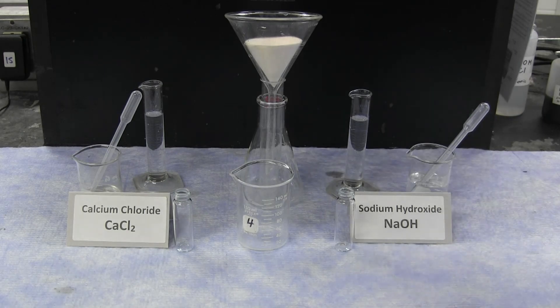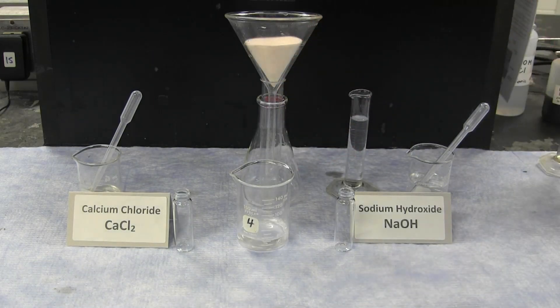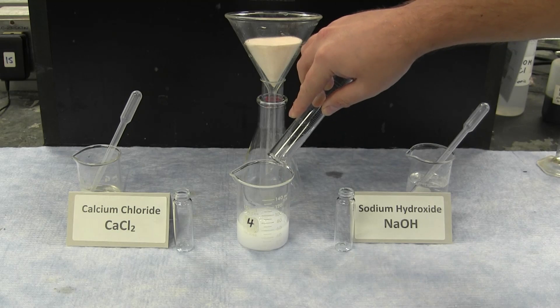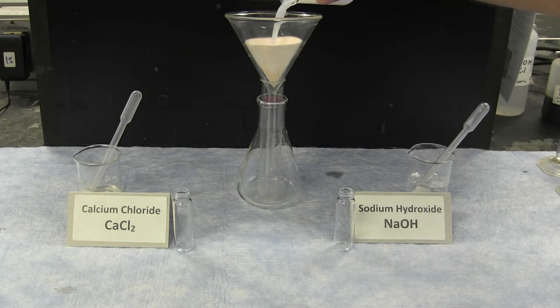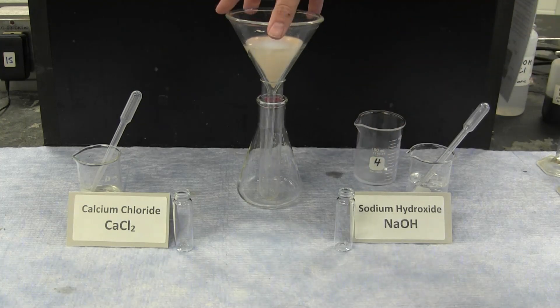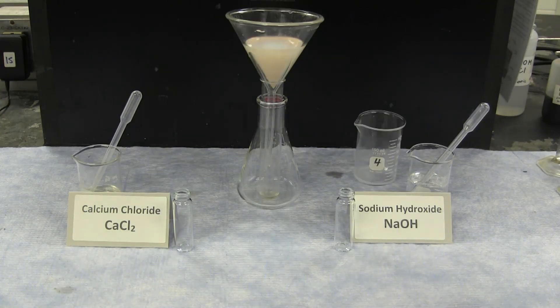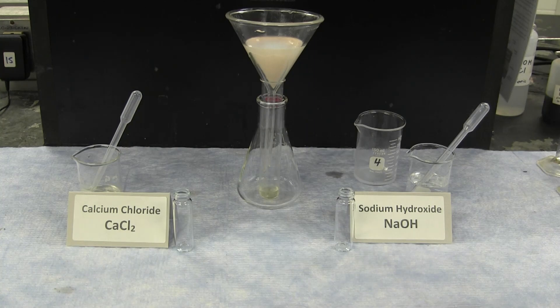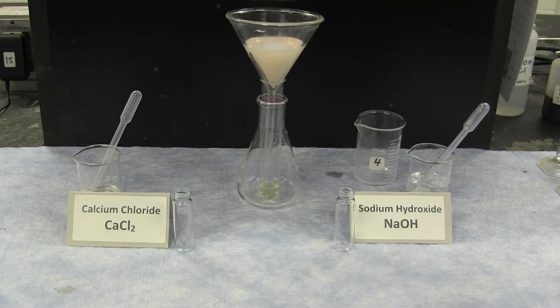Exactly 25.0 milliliters of calcium chloride is reacted with 25.0 milliliters of sodium hydroxide. The resulting solution can then be filtered through filter paper. The filtrate, which is the liquid that passes through the filter paper, contains any unreacted ions. All of the reacted ions, including all of the limiting reagent, are contained in the solid, which is trapped in the filter paper.